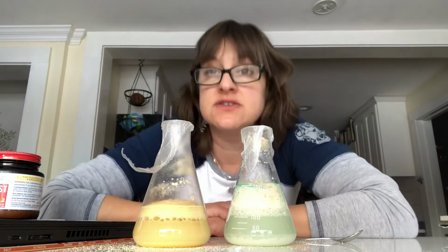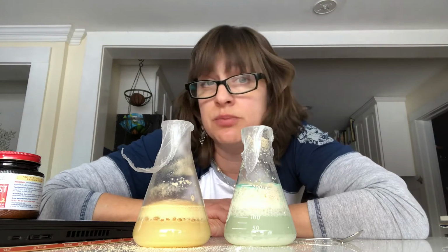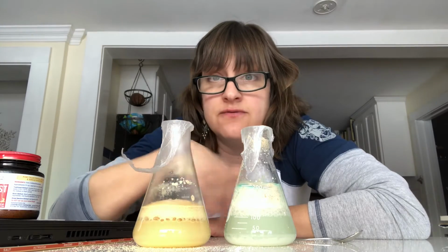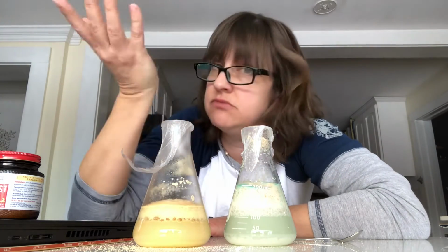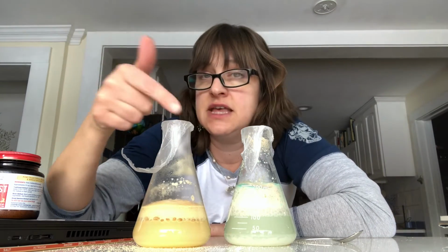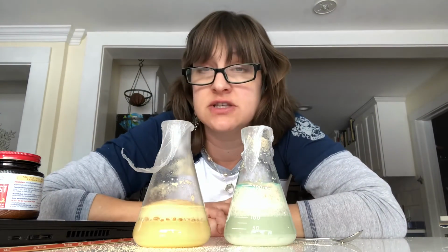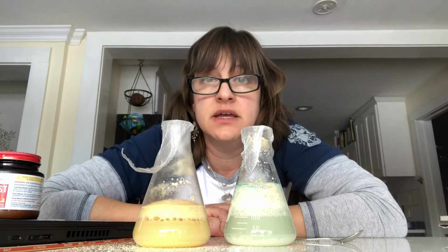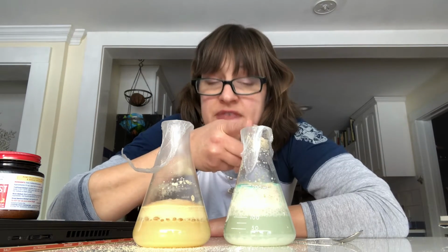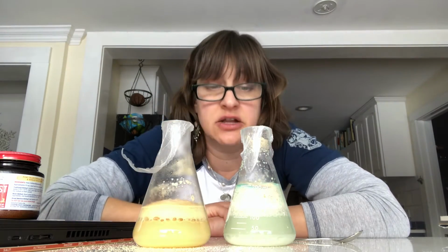So think about the process of cellular respiration. Think about what we've discussed in terms of that's what we do, and we're breathing out carbon dioxide. So what do you think that means for the processes happening in these flasks? And then I want you to look at the color changes. So bromothymol blue, think back to the exercise lab, go back to the beginning of this video, read the top of the lab where the instructions are, and I told you about what the color change of bromothymol blue means. And then I need you to do the same thing for the methylene blue, which you see they've both had pretty drastic color change here.